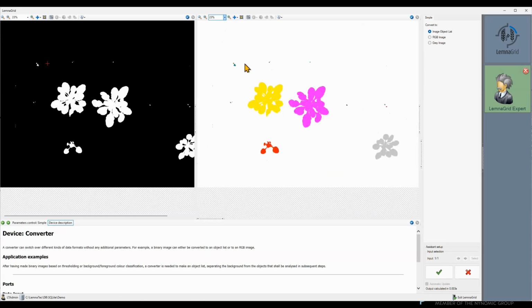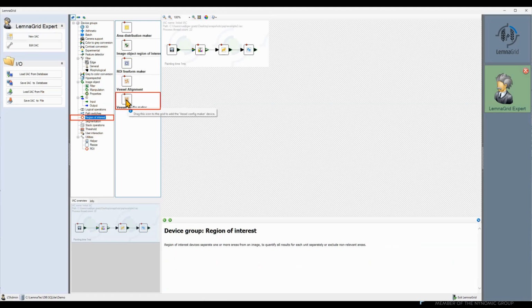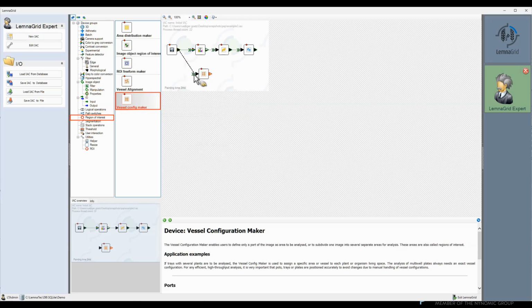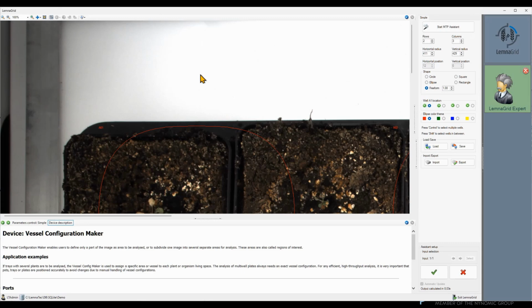And we have a second problem. We need to somehow add an identifier to differentiate the different plants found in the image. Both of these tasks can be achieved using the Vessel config maker device. This creates a special version of region of interest. At the same time, it's also the most common use case for a region of interest.